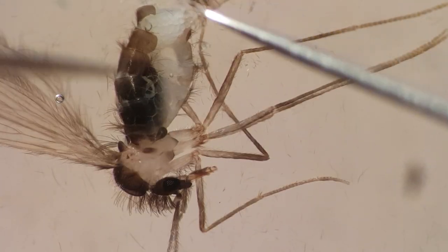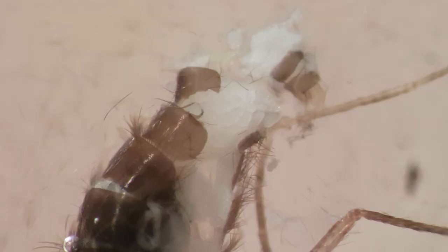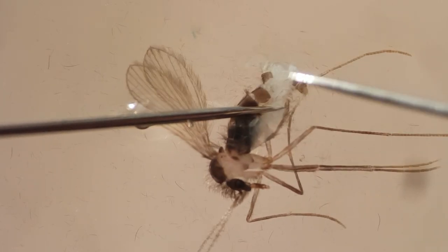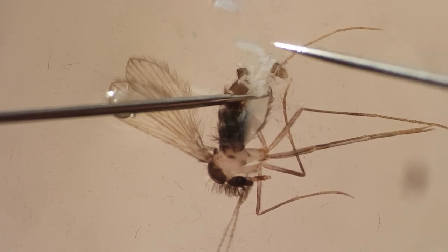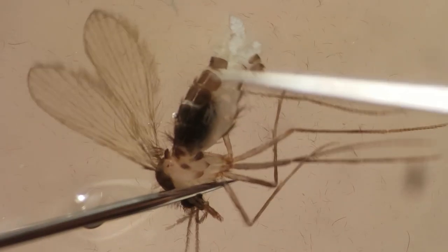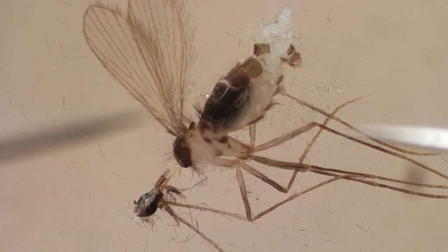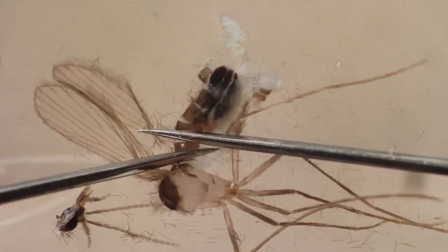This fly fed on blood two days ago, so her eggs are starting to develop. Carefully, push the eggs out and move them away. At this moment, the gut is still attached to the head. Cut the head off and then proceed to push out the gut with the side of your needle, as if you were squeezing out toothpaste.